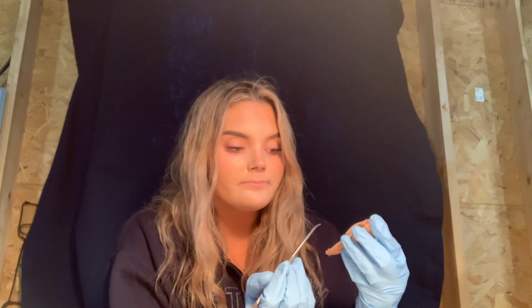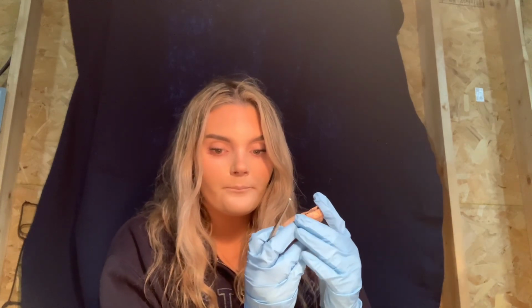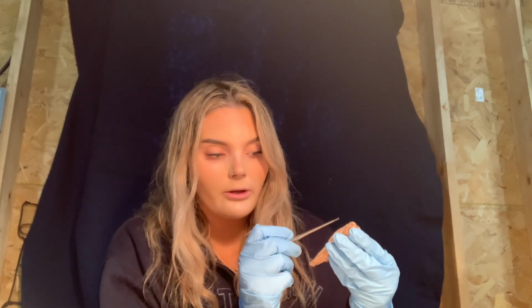And we have the hippocampus. The hippocampus is down over here. It is below the lateral ventricle. And the lateral ventricle is up here, so it's down over here. And it also is involved with emotional states and in converting short-term memory to long-term memory.